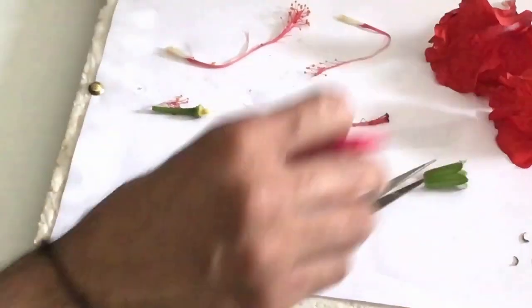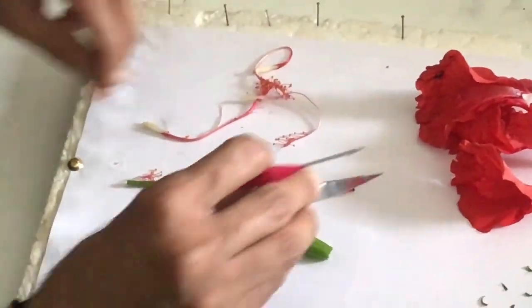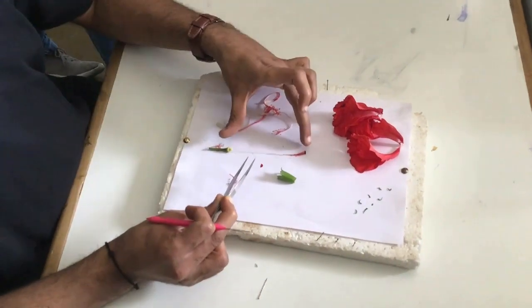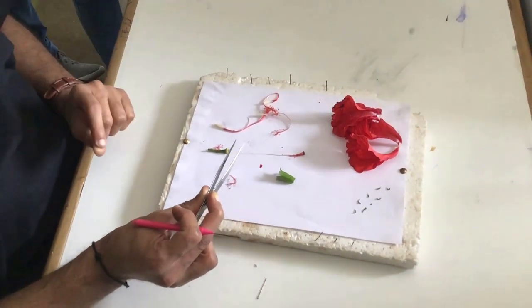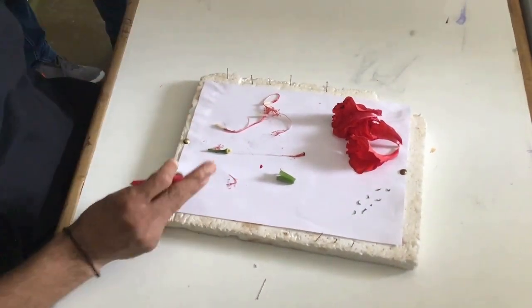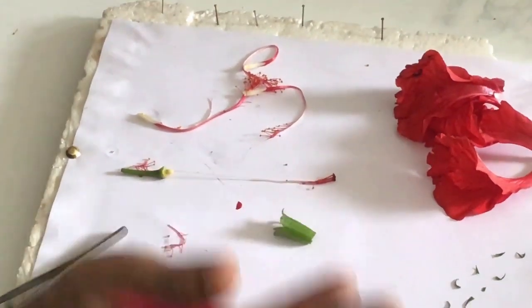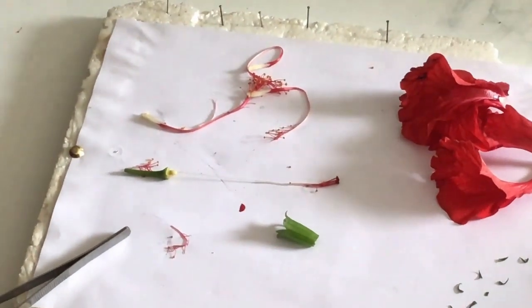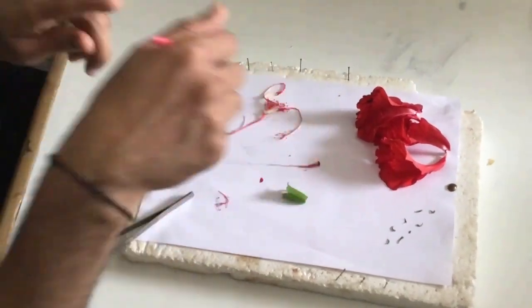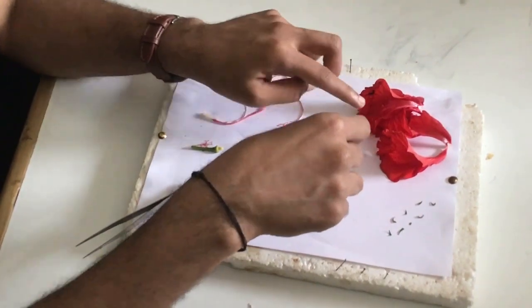Now I will arrange the parts: epicalyx, calyx, corolla, androecium, gynoecium. Gynoecium consists of stigma, style, and ovary — together called a pistil or carpel. Anther and filament together form a stamen, and many stamens form the androecium. Is this flower staminate? Yes. Pistillate? Yes. Bisexual? Yes. Gamosepalous? Yes. Polypetalous? Yes.